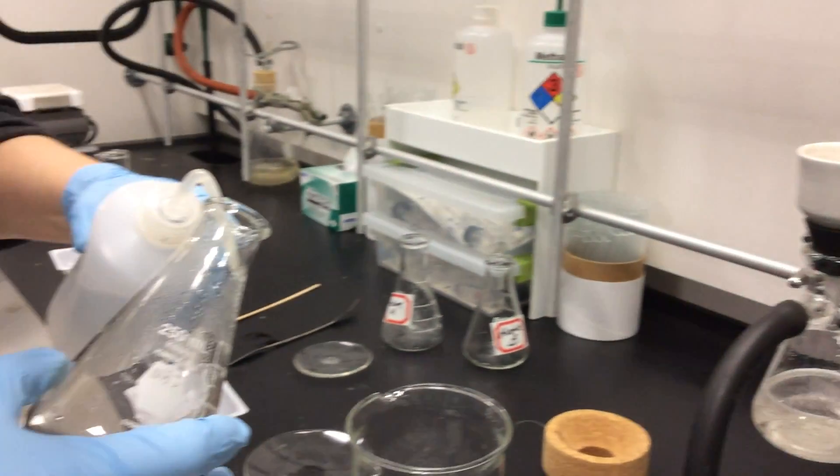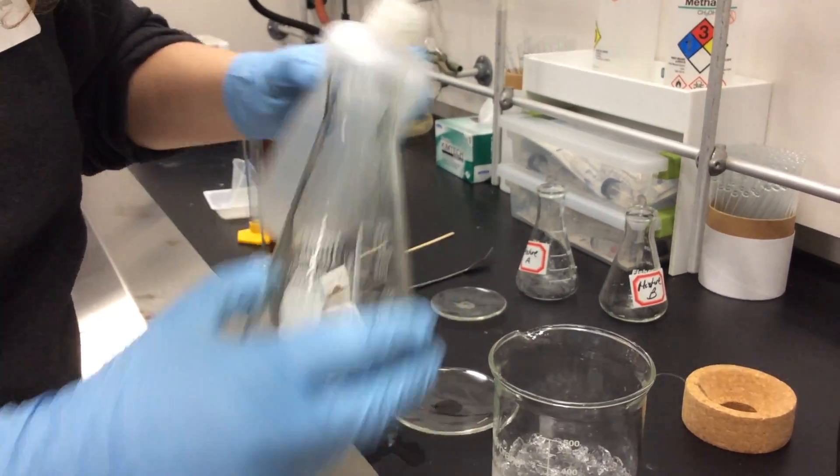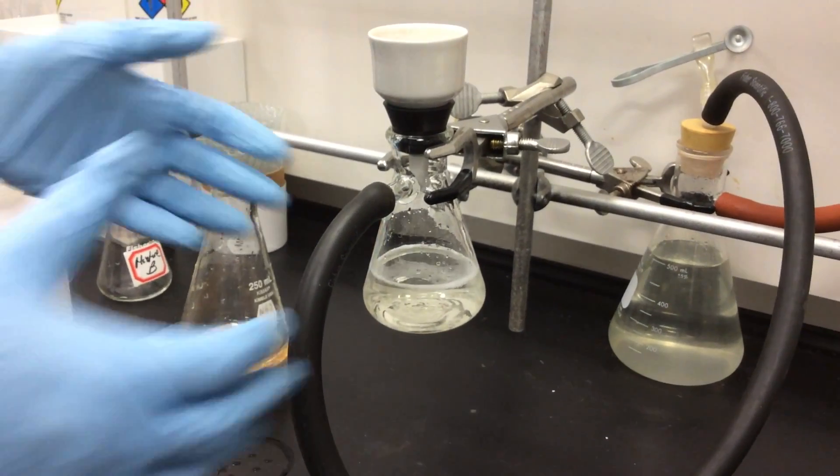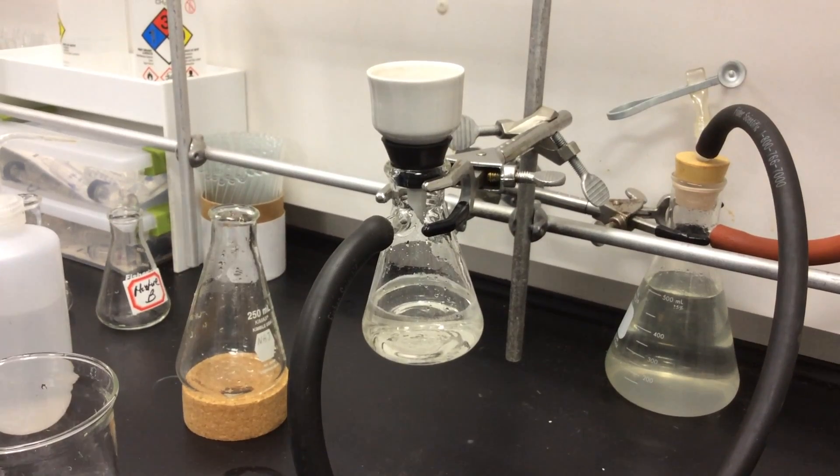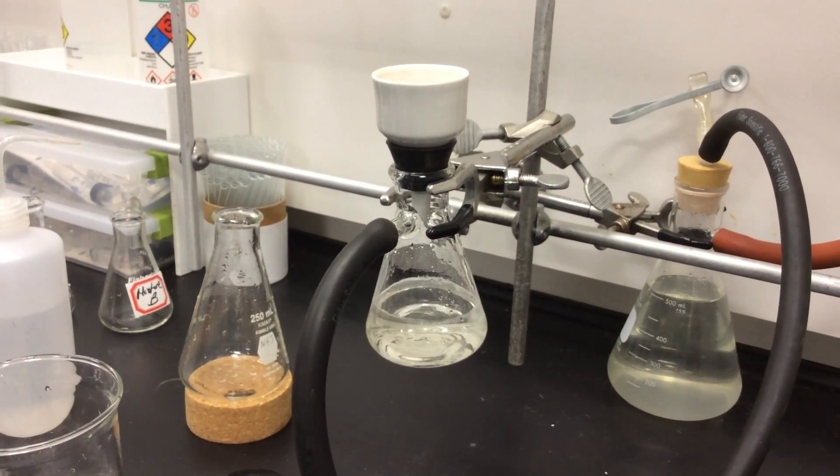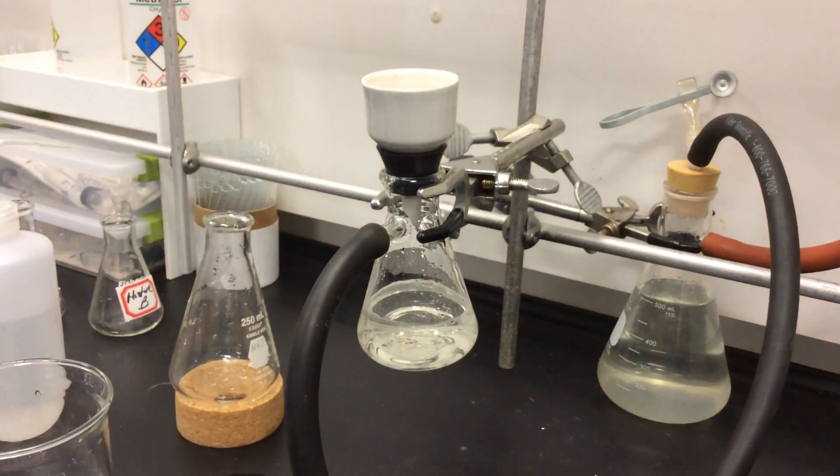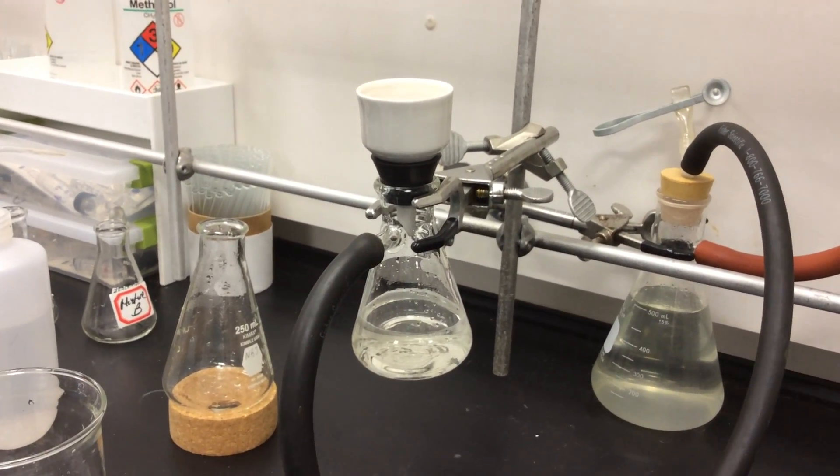Let it sit to ensure that all the liquid is off. If you want, you can take a little bit of distilled water again and rinse your flask just like we did the last time. We push the funnel just to make sure all the suction is happening and all the liquid has dropped down, and the crystals are definitely separated from the liquid.